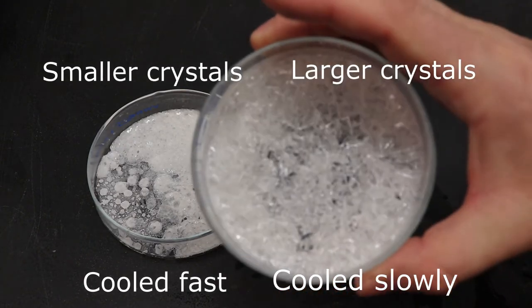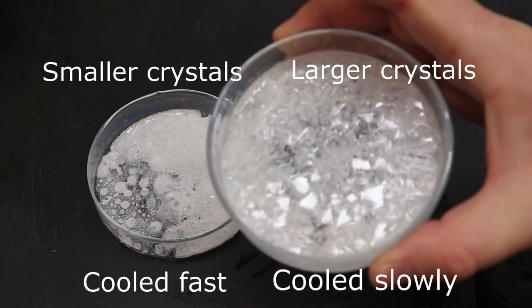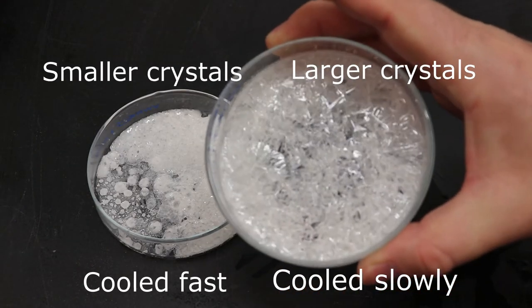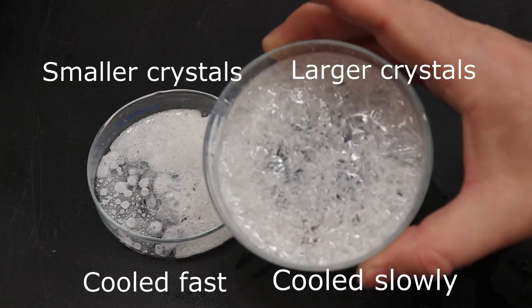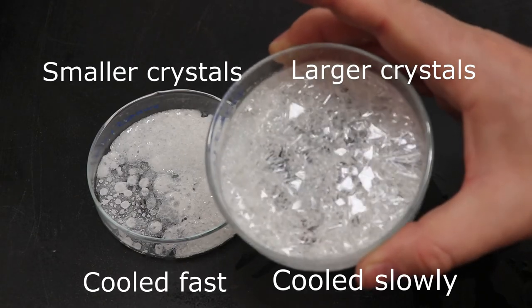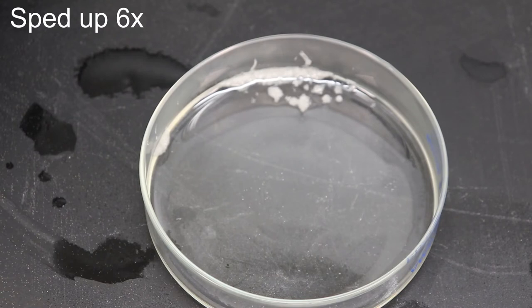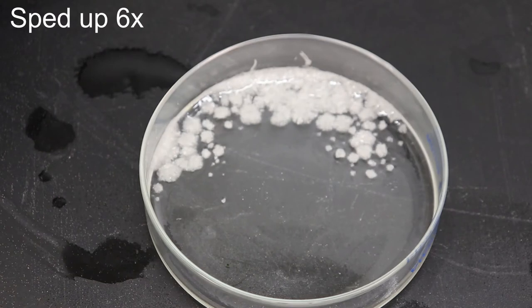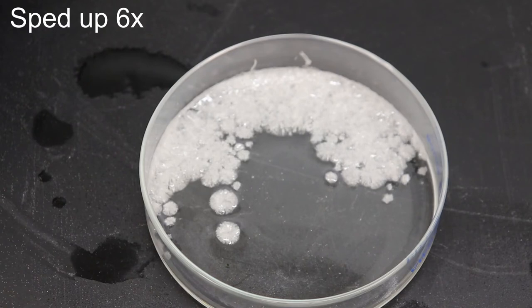Something else that is difficult to see on the camera, but maybe you can kind of see it there, is there's a geometric shape to those crystals. Again, this is sped up to six times normal speed. Just like the first time, the crystals grow into rhombus shapes with a snowflake pattern, but it's kind of hard to see with this angle and this lighting. I'm skipping the video ahead periodically just to get through it.